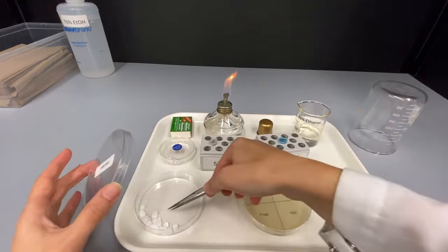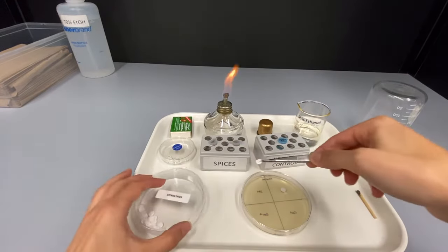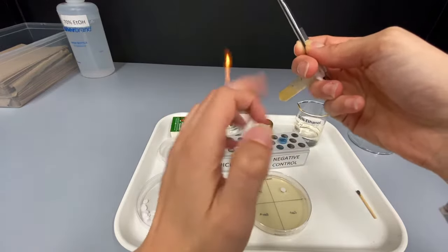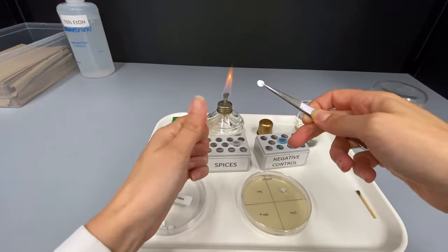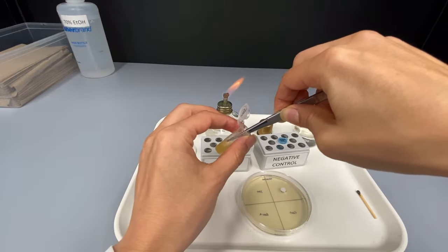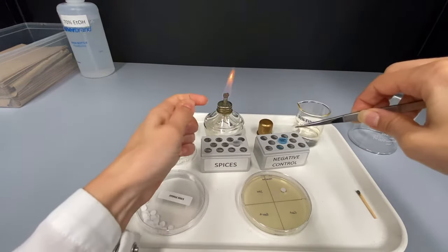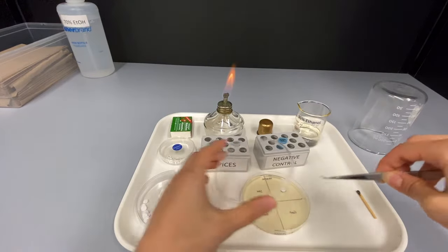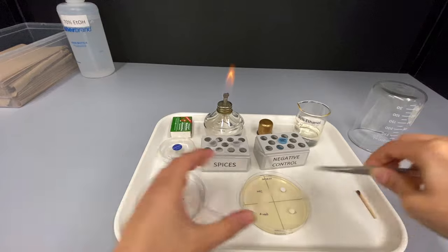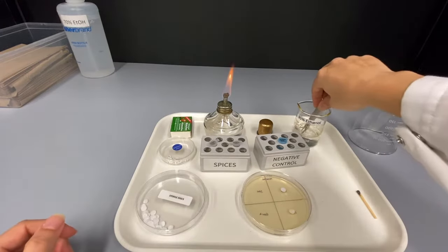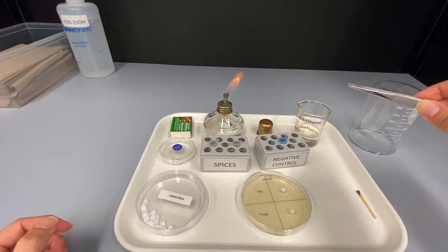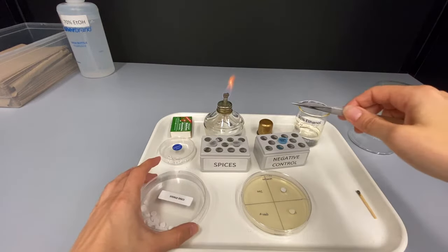Repeat the same technique for each treatment disc, tapping each tube before inserting the disc to make sure it is well mixed and remembering to sterilize your forceps between each treatment. Remember, once you put a disc on the plate, do not move it, even if it is not perfectly centered. This will avoid possible cross-contamination or errors in your results.